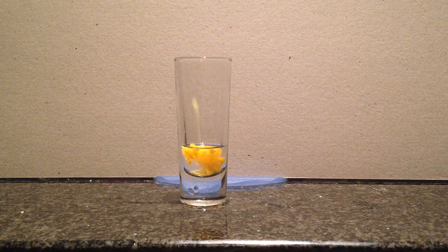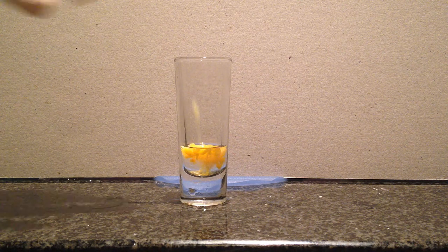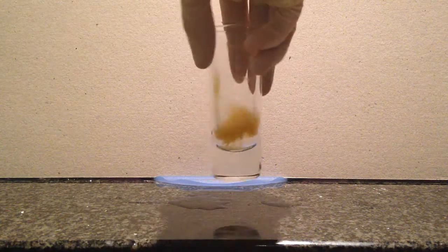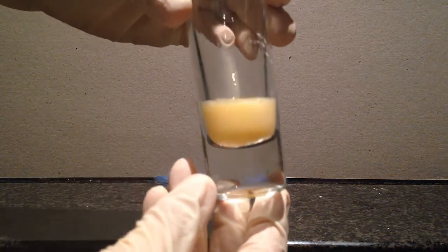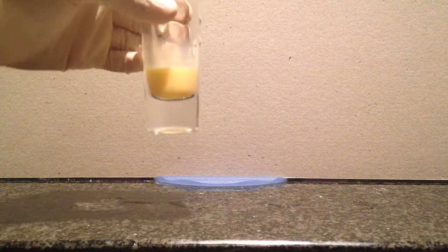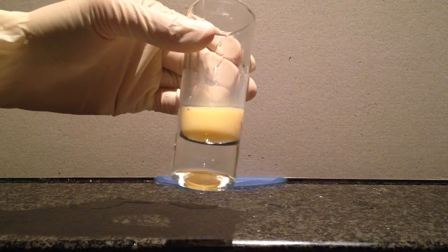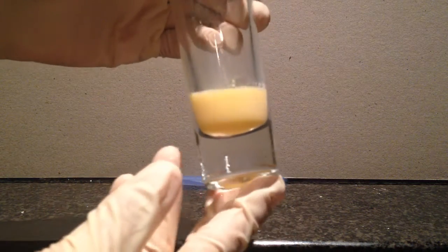It's about enough. Nope, nothing. Okay, let's stir this thing. Whoa. Hang on. It could be bubbles. No, I don't think so. Actually, no, I can't hear them popping. But for it to go white, there must be some bubbles.